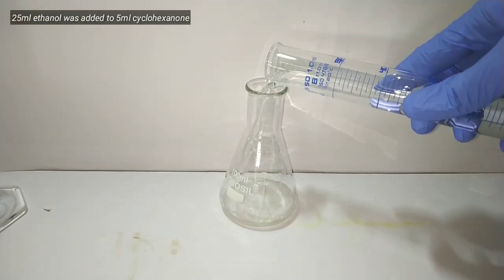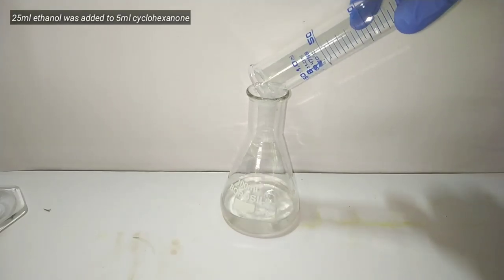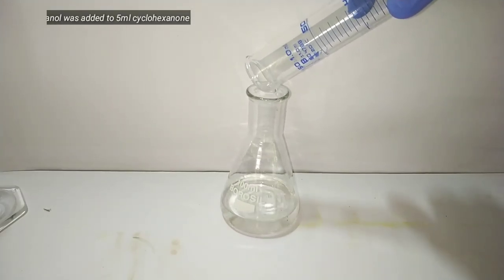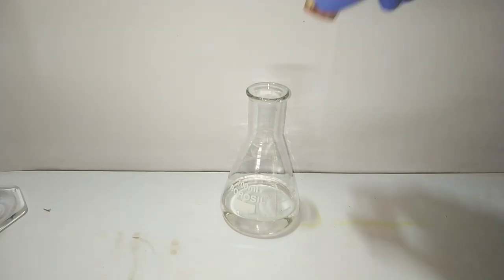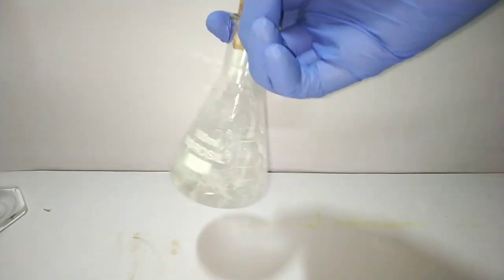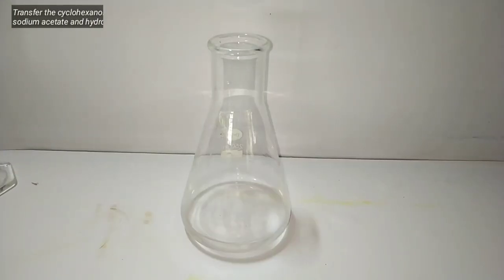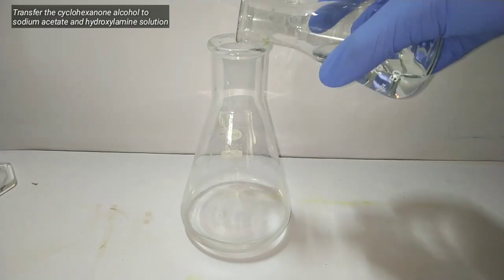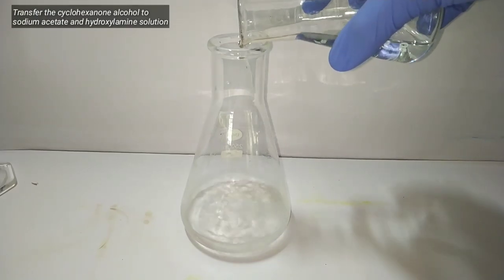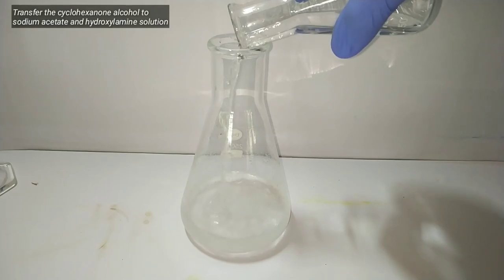We add 25 ml of ethyl alcohol to the cyclohexanone. Ethyl alcohol solubilizes the cyclohexanone and thereby makes the reaction in aqueous medium feasible. Now we transfer the cyclohexanone-alcohol mix to the sodium acetate and hydroxylamine hydrochloride mixture.